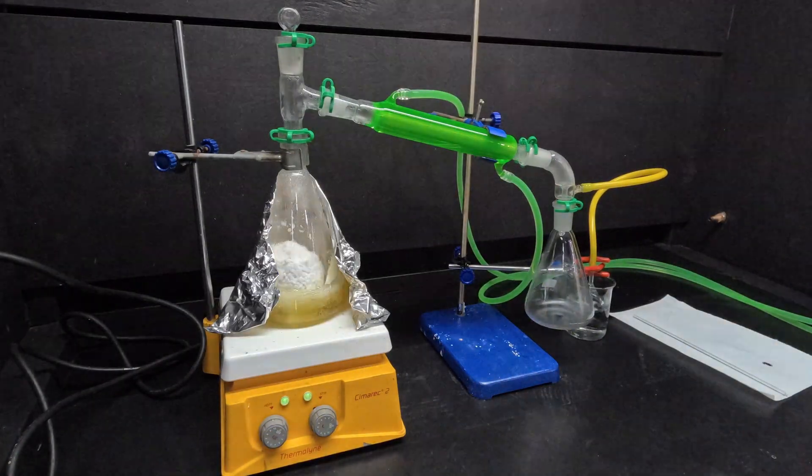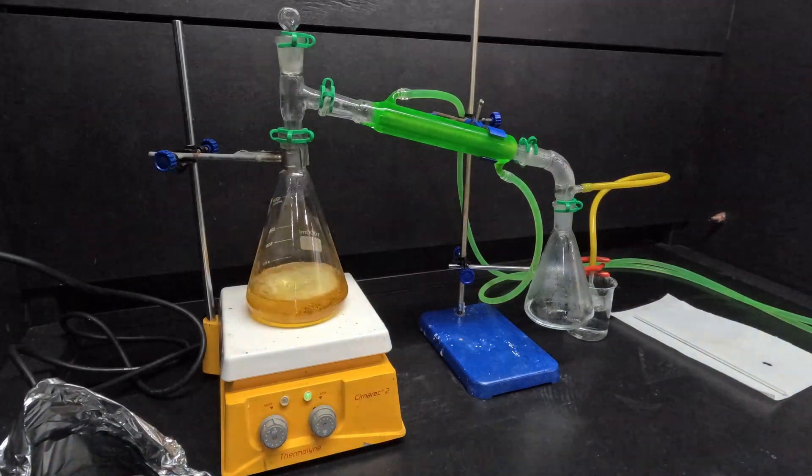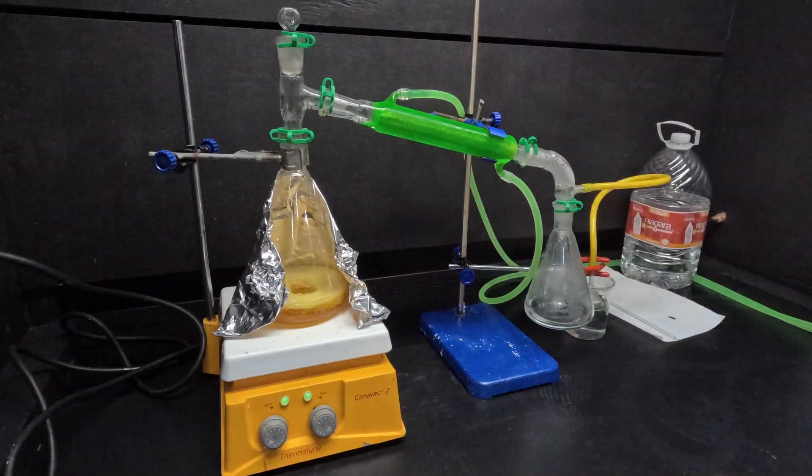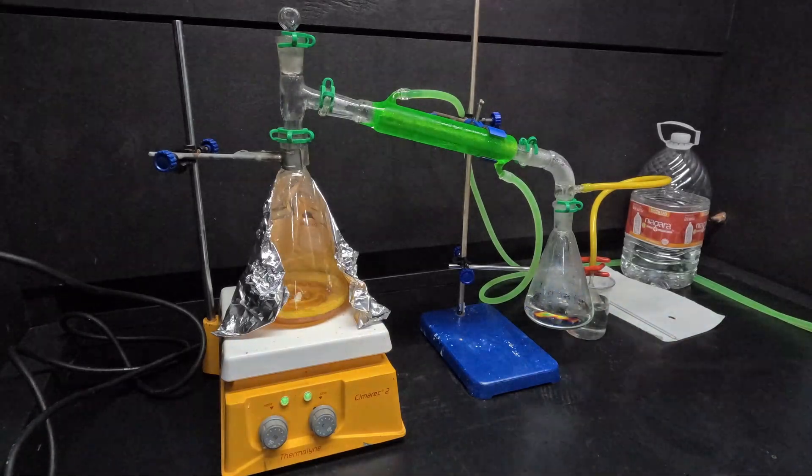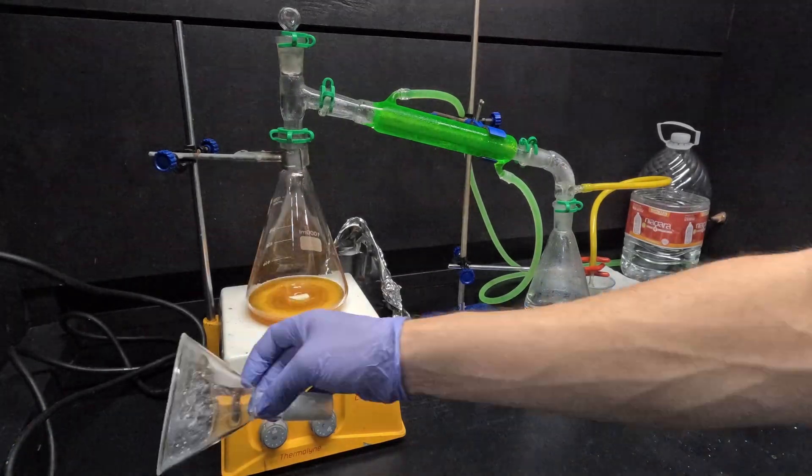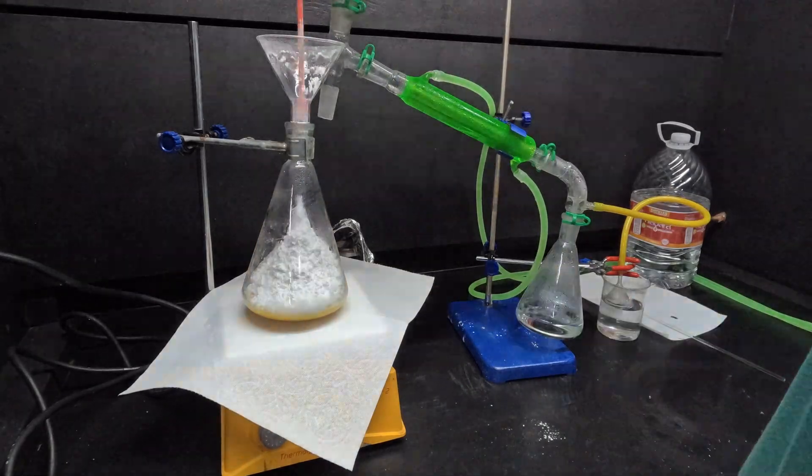Here's a time-lapse of the distillation. Once there was headroom in the flask, I paused it for a bit just to add the rest of the packet of PABA.